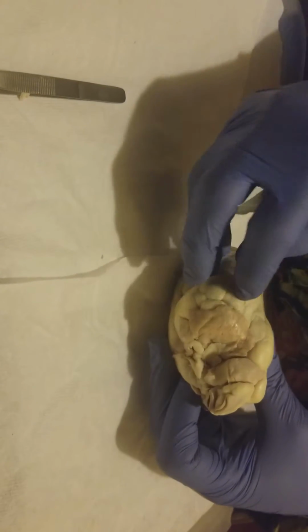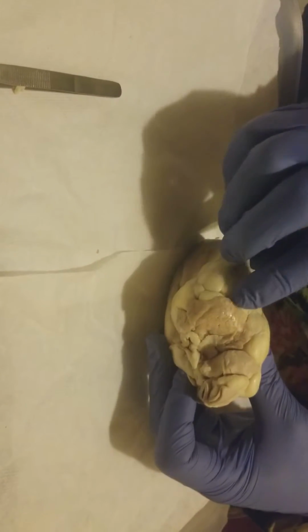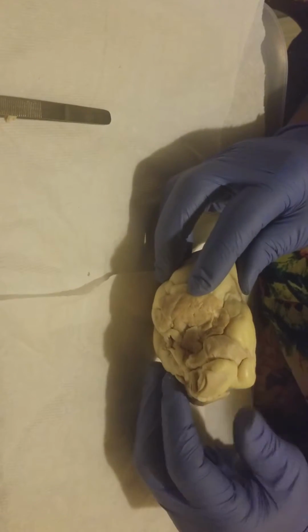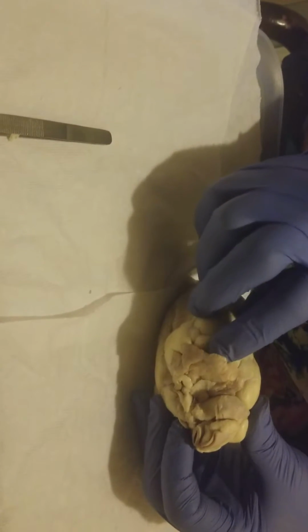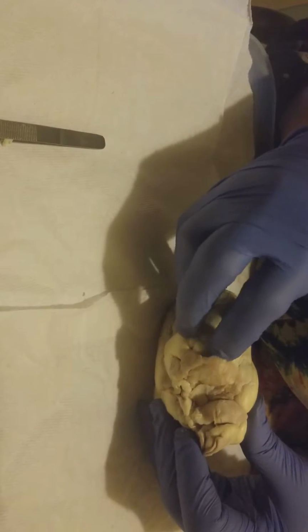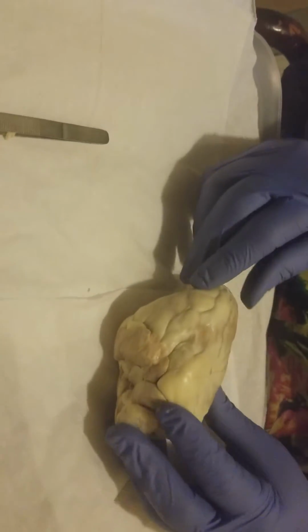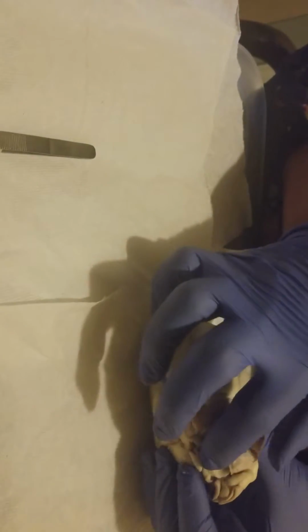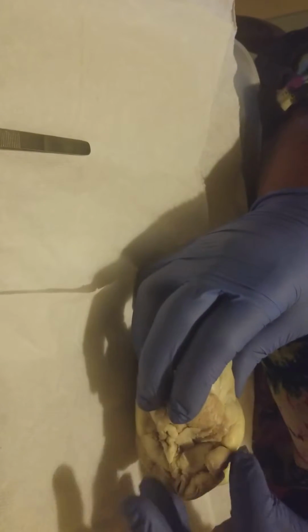here is the left auricle, this brown flap here, and then under here is the atria, and then this one here is the right auricle, and under here we have the atria. So we have the left atrium here, and then the right atrium is right here. From this anterior view, I can see this vessel between the atrium, and then I have the pulmonary trunk right here.